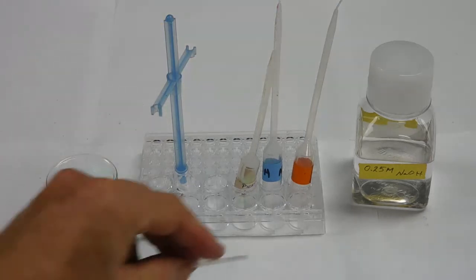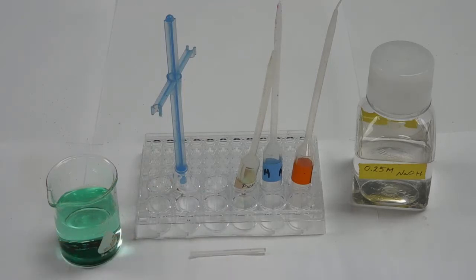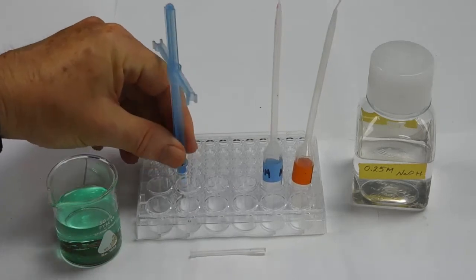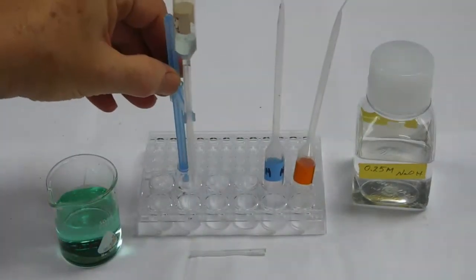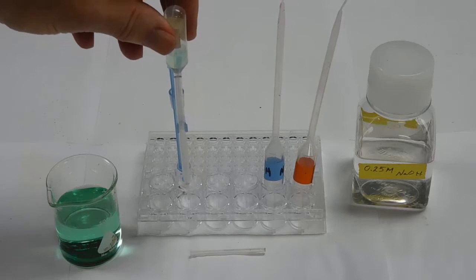I also have a stirrer which is made from the tip of a straight stem pipette, and I'm going to use that for stirring. What I'm going to do is put my pickle juice pipette into the holder, and we're going to add some of the pickle juice, and I'm going to count drops.